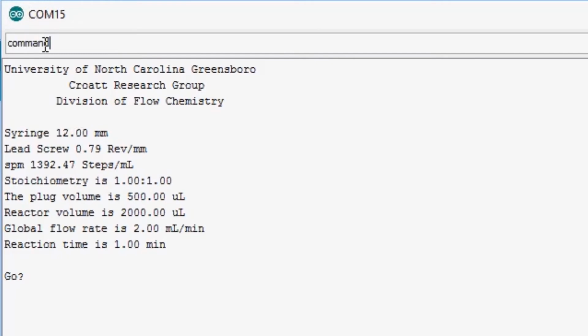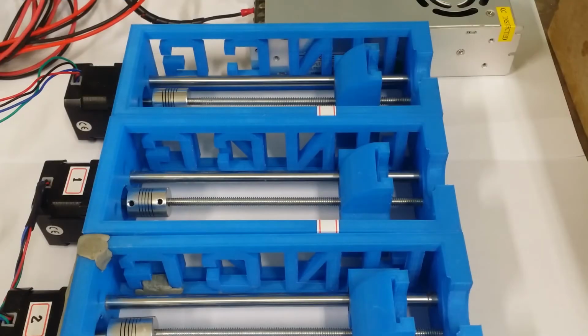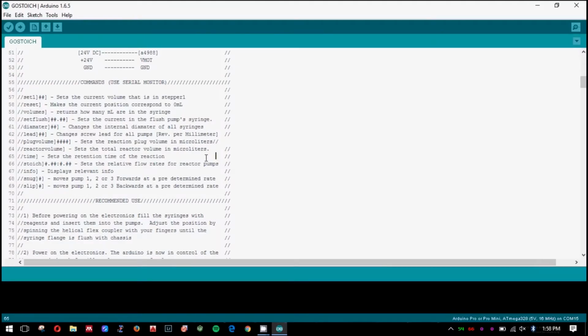The command comes first in lowercase and is always followed by a closed bracket. Then if the command you are using requires a number, the number comes next, followed by another closed bracket. An example is the diameter command, which informs the microcontroller what diameter syringes you are using. An example of the proper syntax is like this. This code is currently set up for conducting sequential plug flow reactions. Specifically, the 2 reagent pumps, number 1 and number 2, are initiated simultaneously. Once the plug volume is achieved, the reagent pumps are turned off and the solvent pump pushes the plug through the reactor.